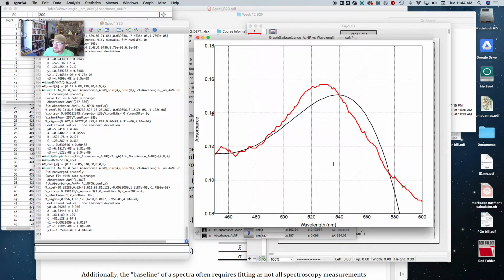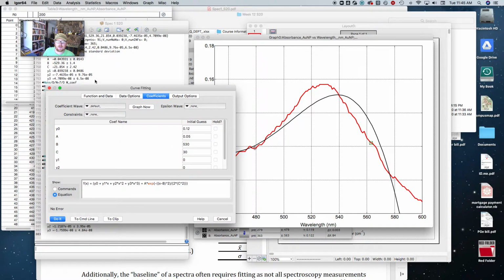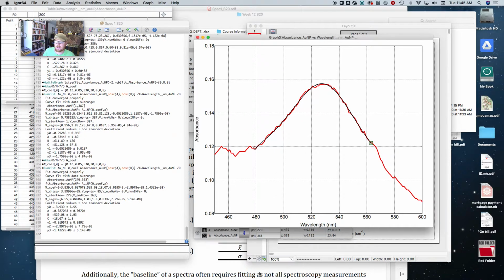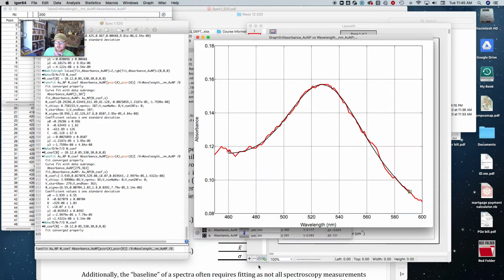So, oops, perfect example. So now let's say that this happened to me and that it didn't like this. So I'm going to go back and narrow my cursors one more time. And cursors, I think maybe because I was fiddling around with that cursor last time on the peak. Yeah, so that helped. So now I'm going to expand these cursors out a little bit. Analysis curve fitting, cursors. Okay, beautiful. So that works pretty good.